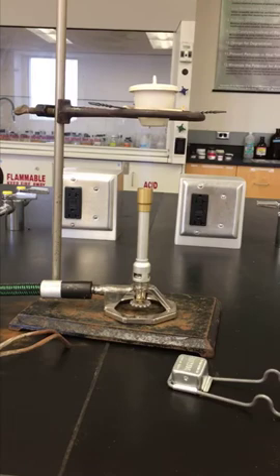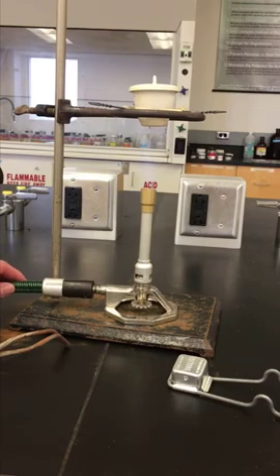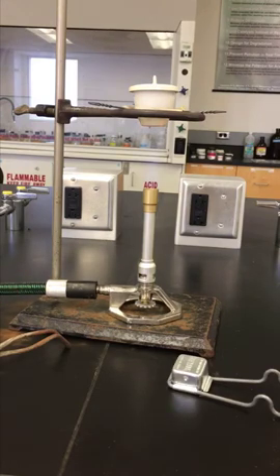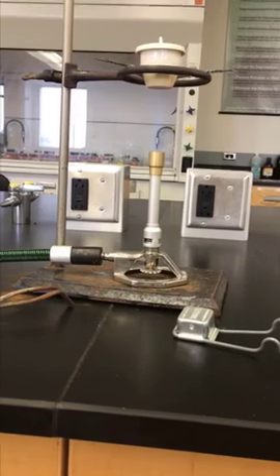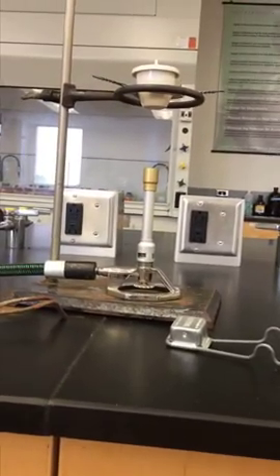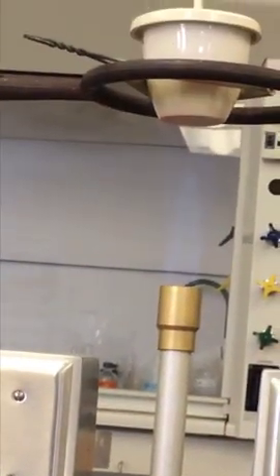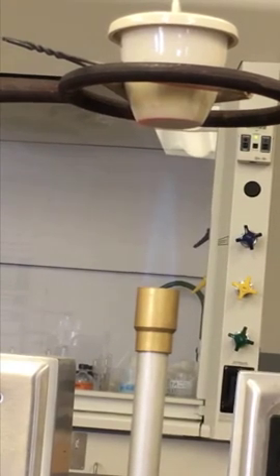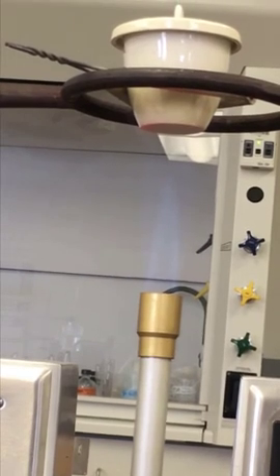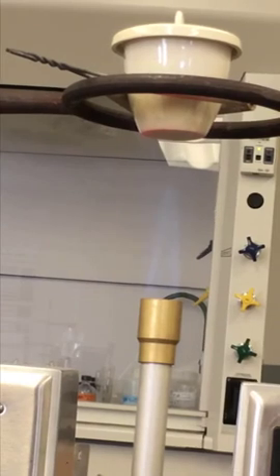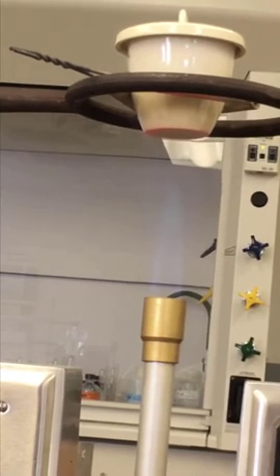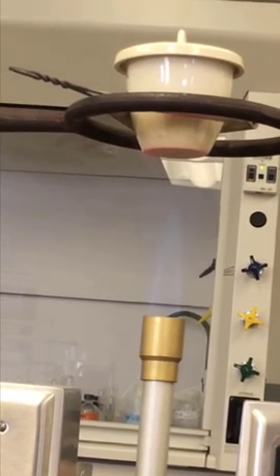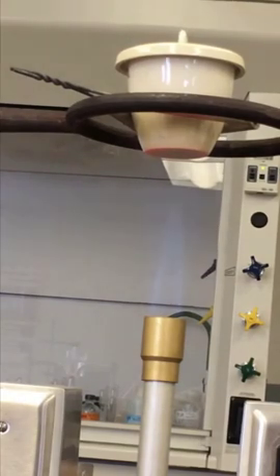So we're burning off the crucible. All the impurities are coming off. I want to have you look at the bottom of the crucible itself. See how the bottom of the crucible is starting to have a reddish glow to it? That means it's getting really hot. One of the things that you want to do before you actually fire the crucible is check the crucible for any cracks. Because it can break if there are cracks or imperfections in your crucible itself. But look at the bottom of the crucible, how red it's glowing. You want to do that for about five minutes.